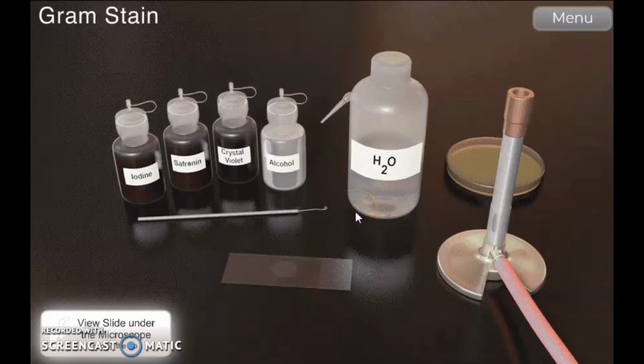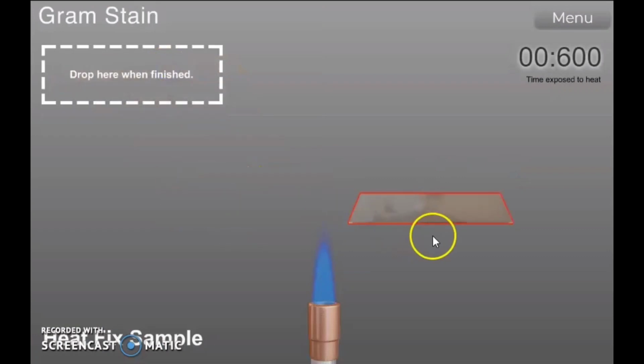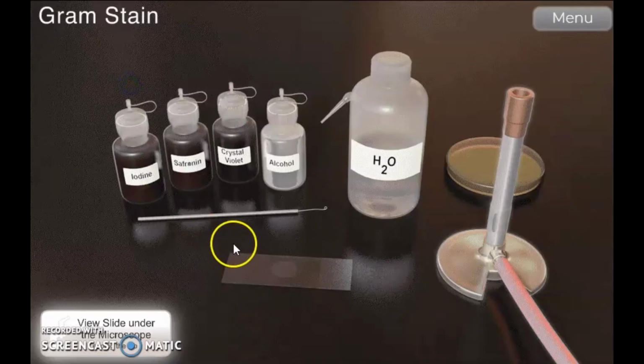First step, click on the Bunsen burner and pass the slide gently 2 or 3 times through the flame. Do not overheat because it can cause destruction of the cells.